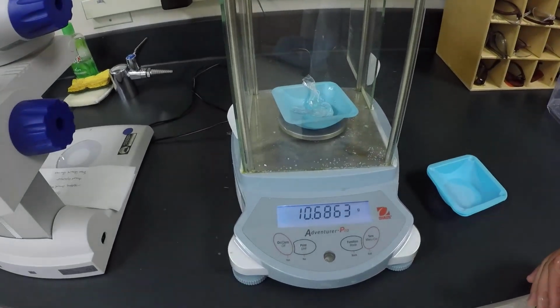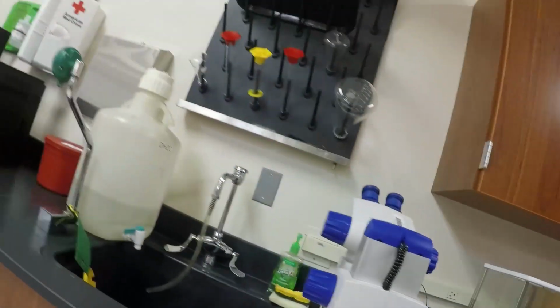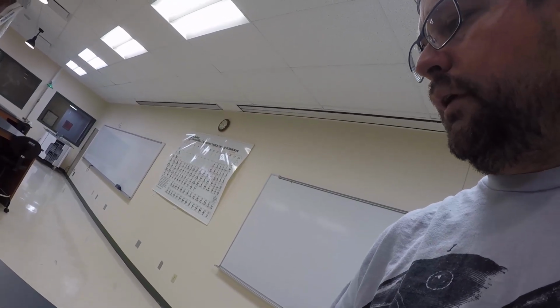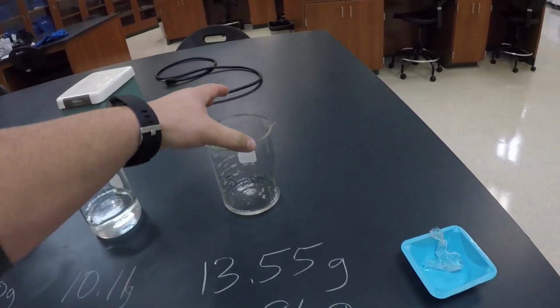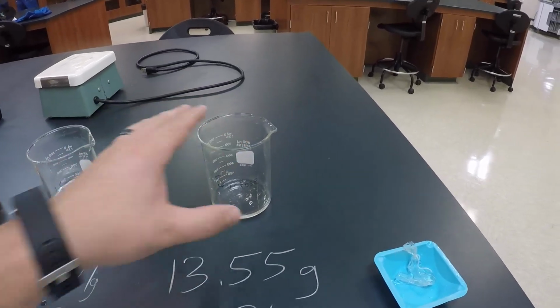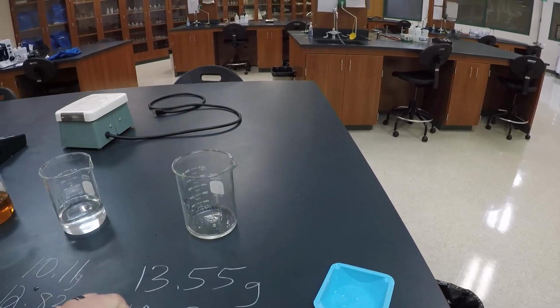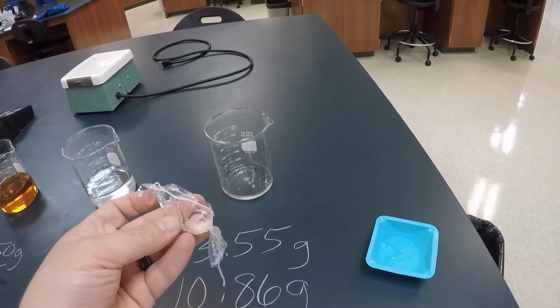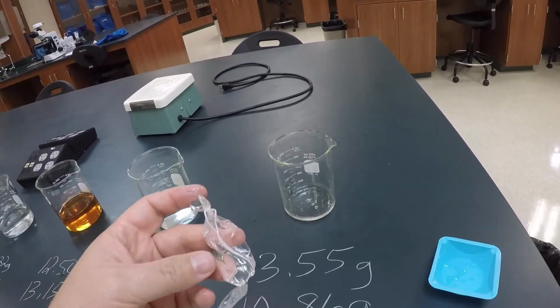Now, I weighed all of them before I put them into the beakers. The weight of this one is 10.68. Again, that's the dialysis bag that had water in it, and it was stuck into sucrose. 10.86, I think is what I said. It really makes no difference because the numbers are drastically different. So in the sucrose solution, the sugar solution, this is osmosis. With the bag that was full of water, the weight of the bag decreased by 3 grams. And you can see that this bag became more flaccid, less water in it.